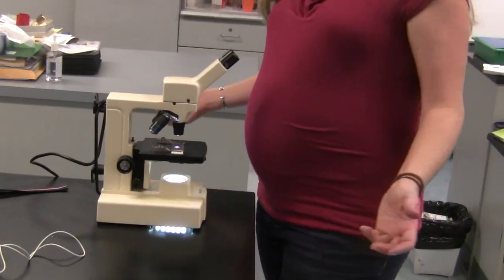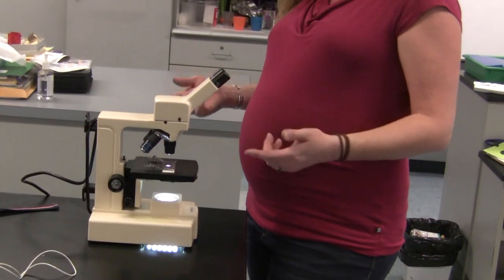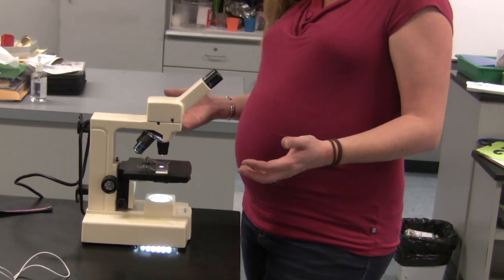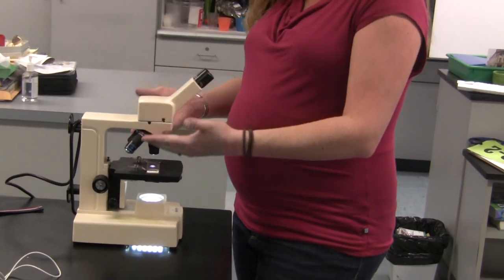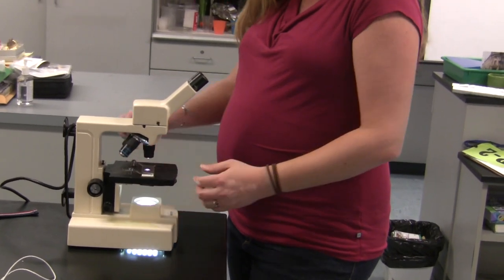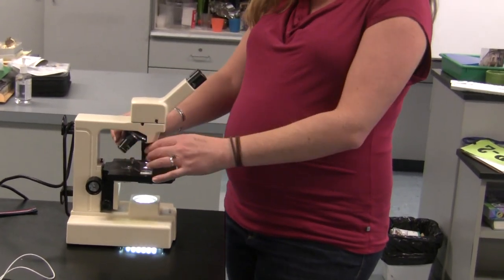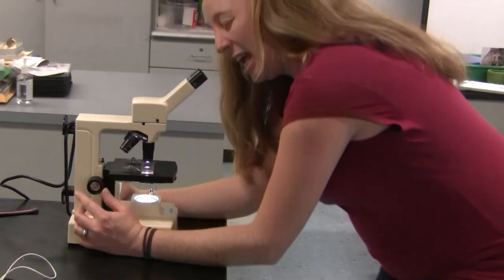Now, what if you want to see it bigger? Once you've seen it and centered it where you want to be, move the stage all the way back down, then switch to a different objective lens and start again.